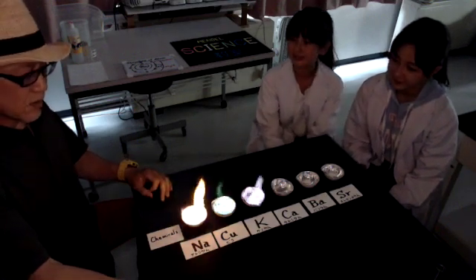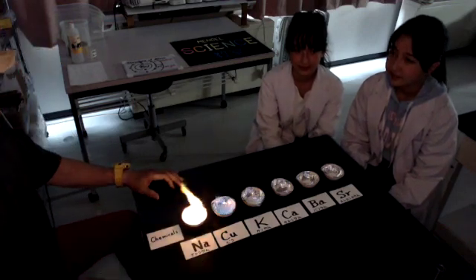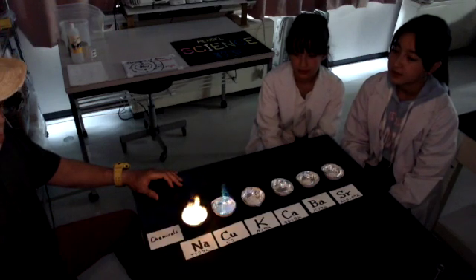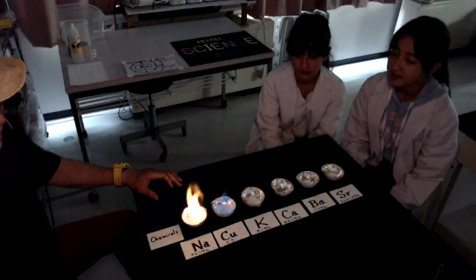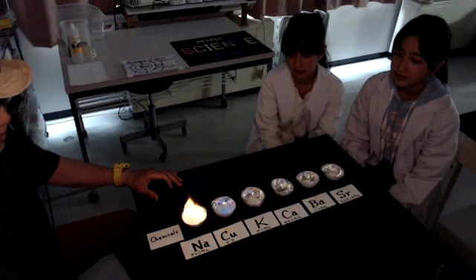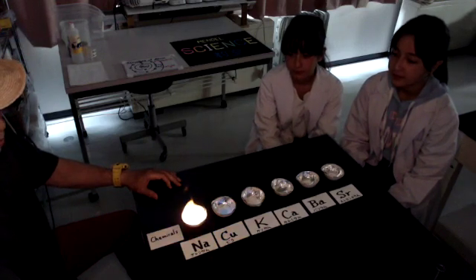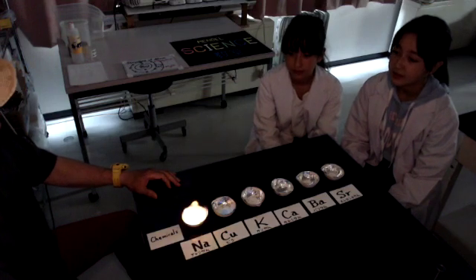Since burning of methanol increases the temperature, that leads to evaporate each element. And then these elements start to show the generation of light in the flame.